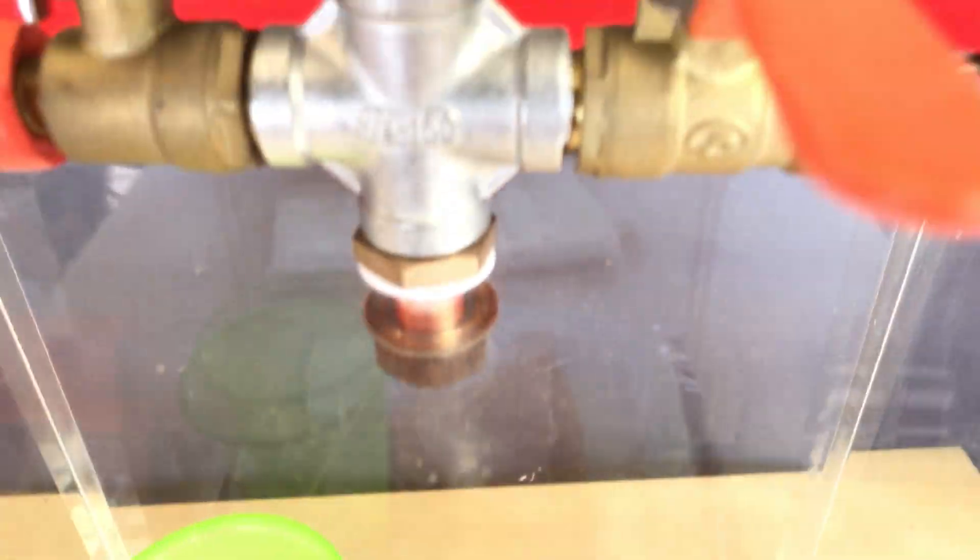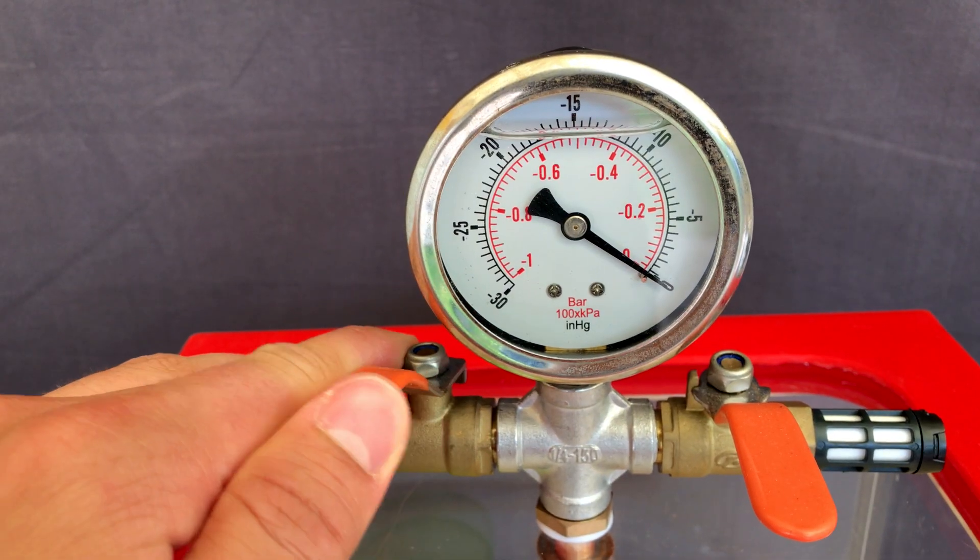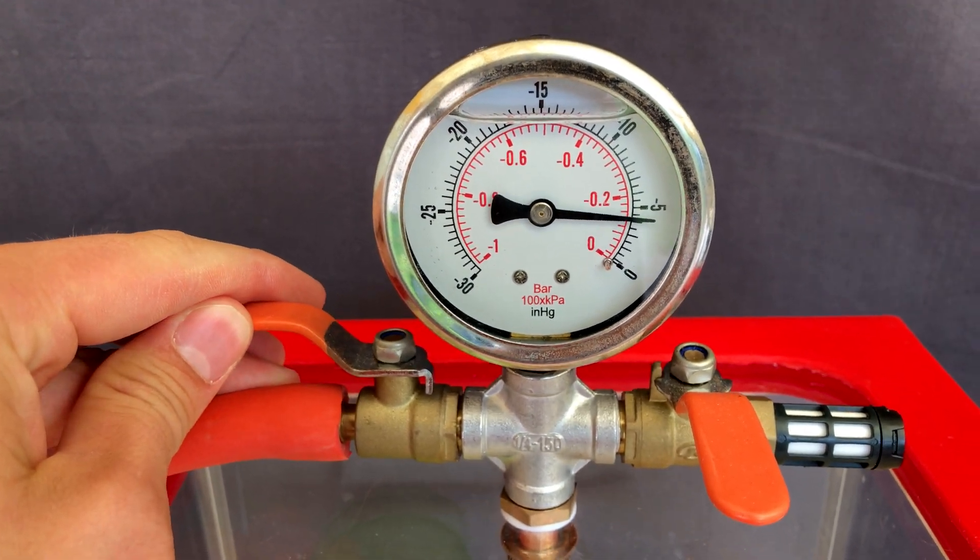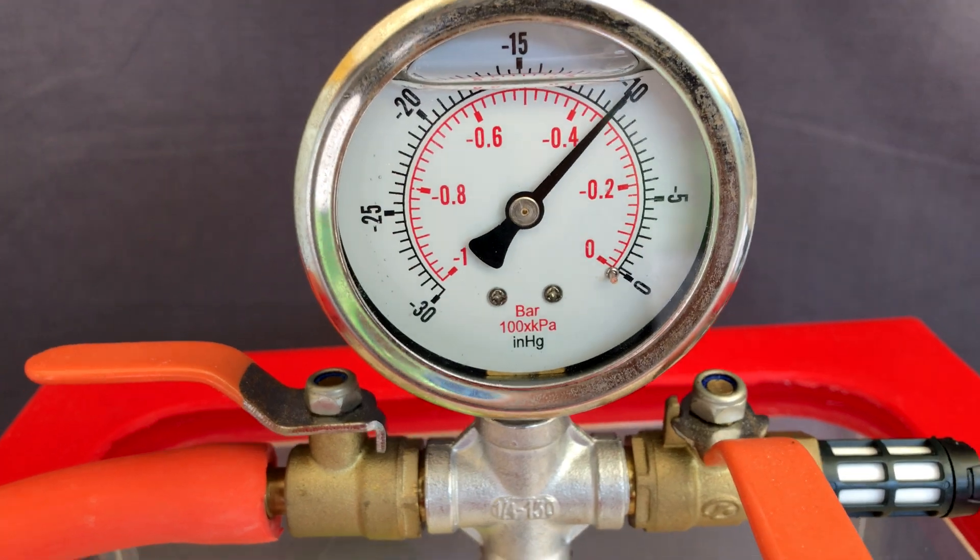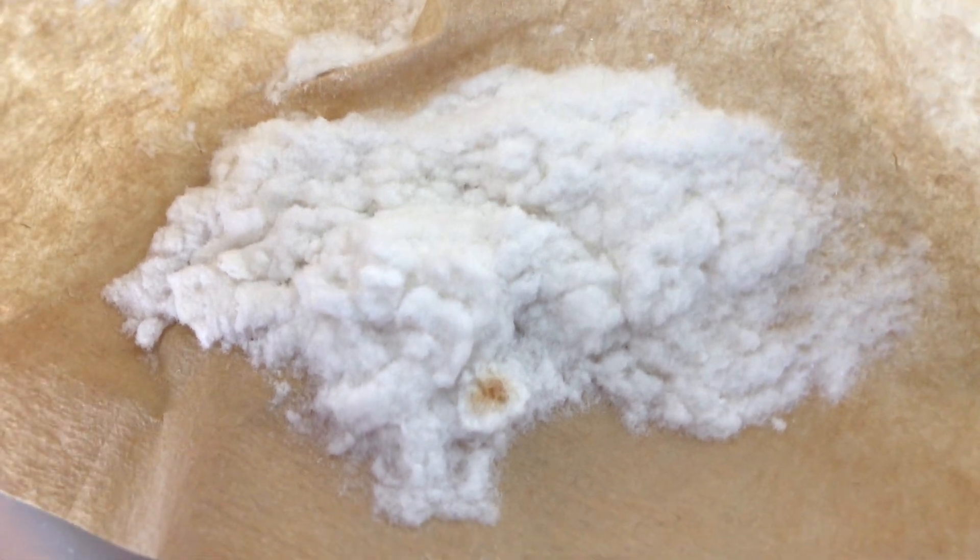Out of laziness, I would always prefer a vacuum desiccator over a normal desiccator. Therefore the vacuum pump was switched on, the chamber was opened, and we evacuated it. It took only three days in the vacuum chamber until it was completely dry.